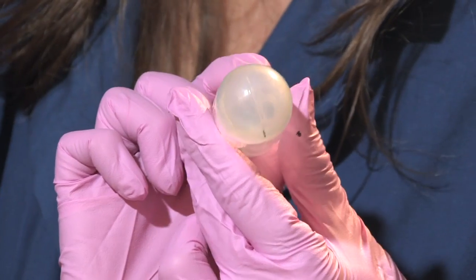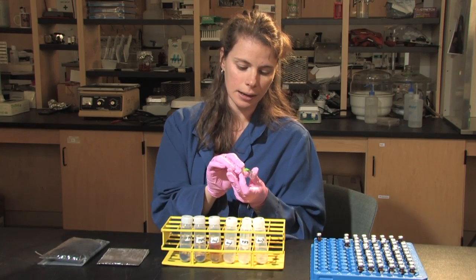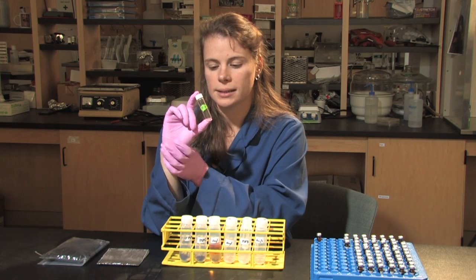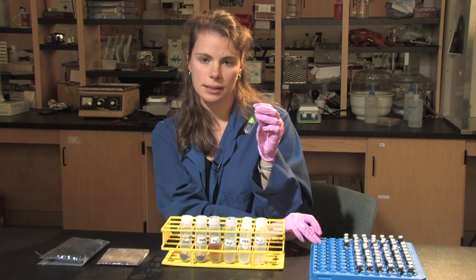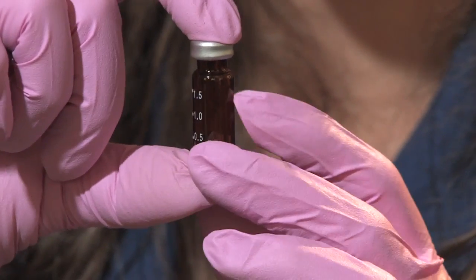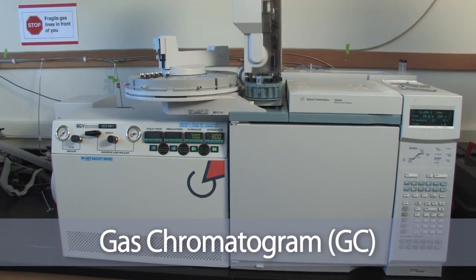The film is then reconstituted again with various solvents and transesterified. Here on day four, we have a five-hour day for 24 samples, and the samples end up in a smaller 8-mil vial. This smaller vial will contain the sample that we want, and it gets dried down under nitrogen gas again. When the samples are ready to be run, hexane is added to the 8-mil vial, and the sample — which is hexane and the phospholipids — is put into small GC vials, which can then be put through the machine so the phospholipids can be seen.